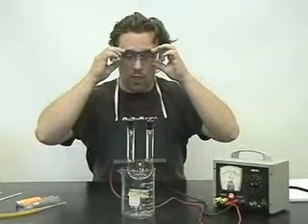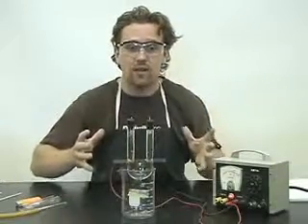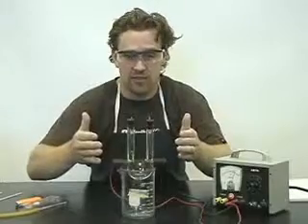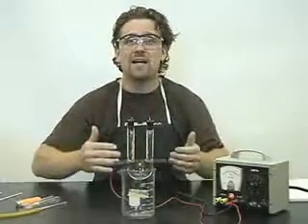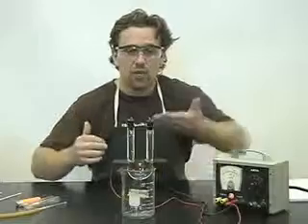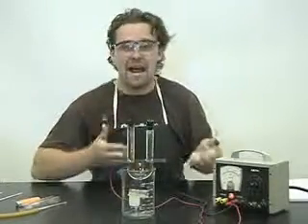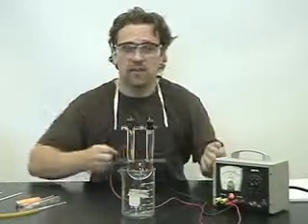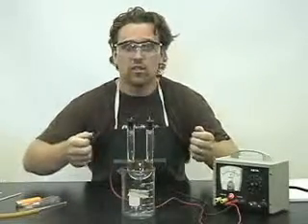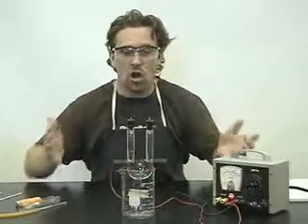Now you'll remember that an electrochemical cell produces its own voltage. In electrolysis, because the oxidation reaction is higher than the reduction reaction, we need to add a direct current. So we add voltage, thereby producing hydrogen and oxygen gas.